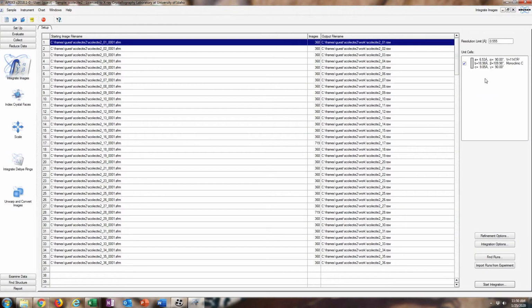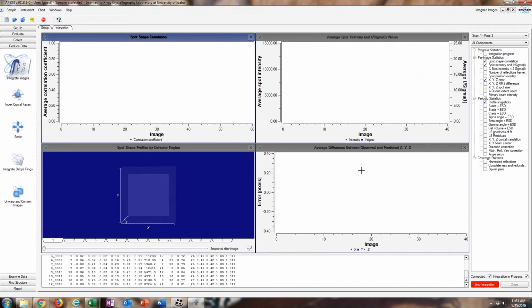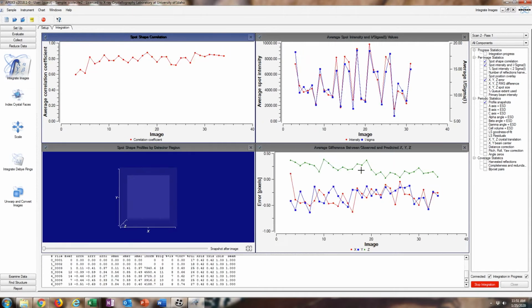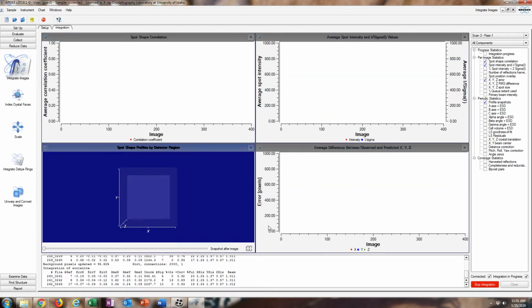And then we can integrate. We can integrate this lattice to optimize the translational vectors and model the intensity maxima. Start integration. And I'm doing this on a faster computer than the one that runs the instrument itself, but it still may take some time to integrate. There it goes, and sometimes the graphics card or something won't be good enough to display these boxes in real time, but here we got a correlation coefficient in the upper left. You got the spot that it's modeling in the bottom left.